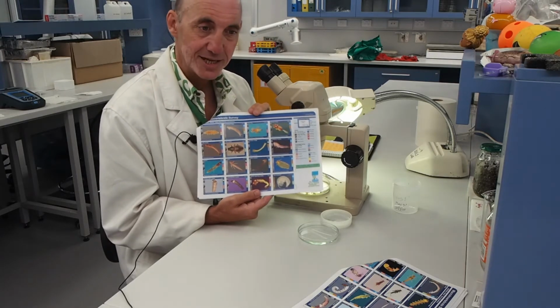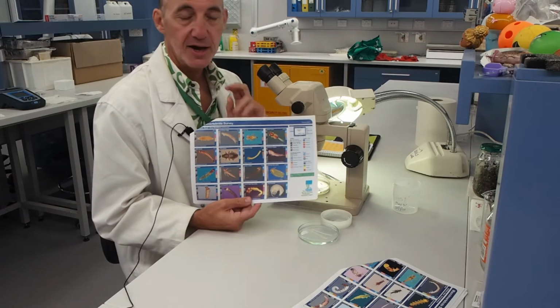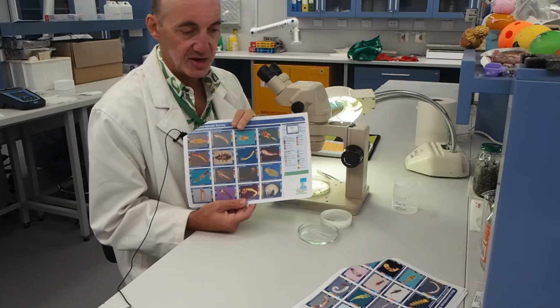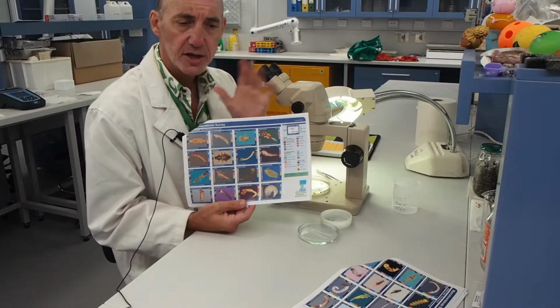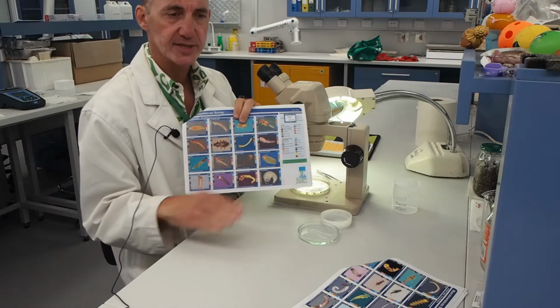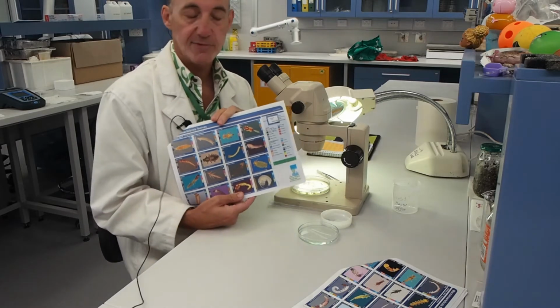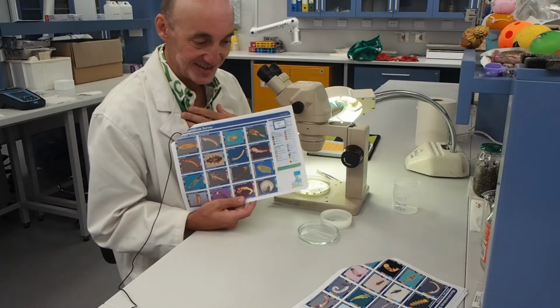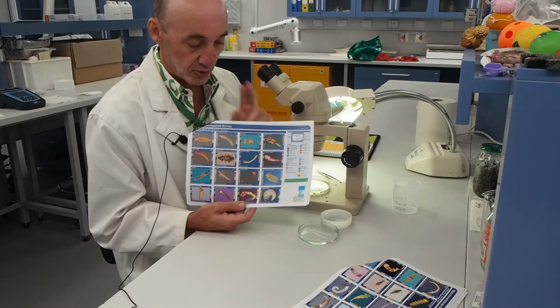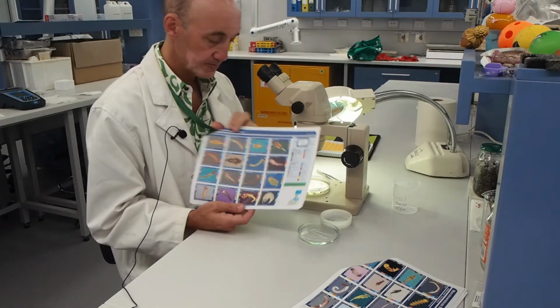It's really the family level that gives us enough taxonomic differentiation about the condition of that stream. If we just dealt at the class or the order level, it wouldn't give us enough information. So we go down to family. We don't have to go all the way down to species. That would be very onerous, and you need a taxonomic degree to do that. I'm not skilled in that regard either, it's a highly specialised skill. So the family level is sufficient to give us enough idea of the health of the streams.